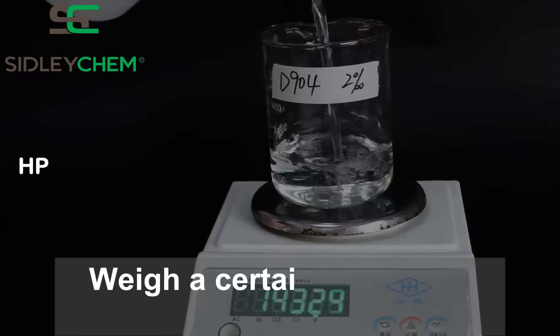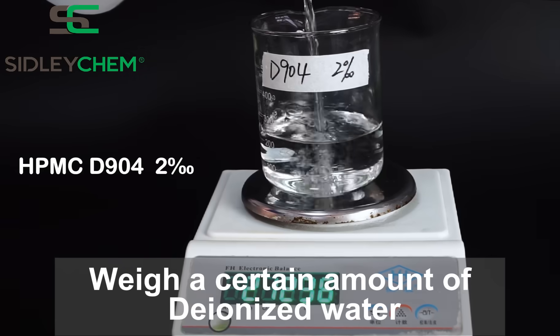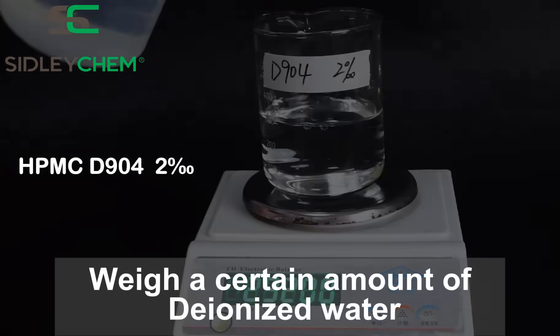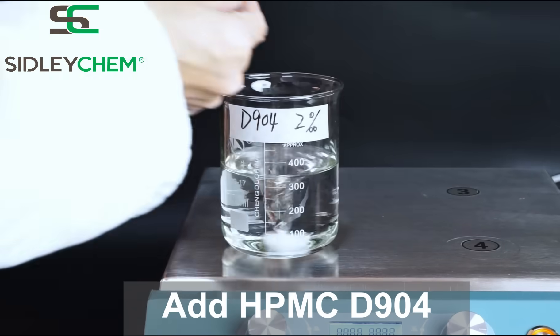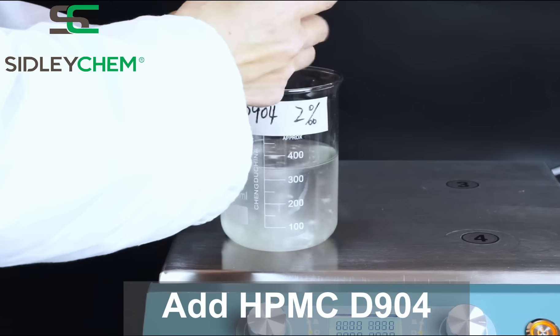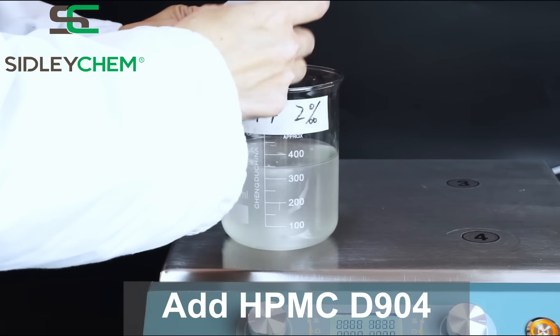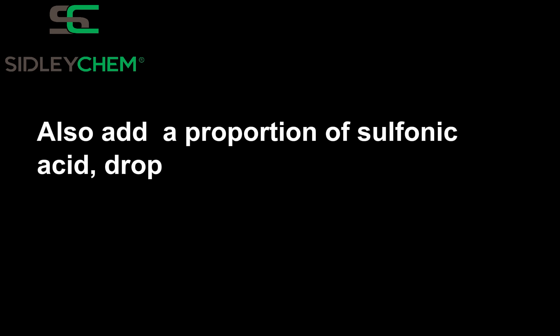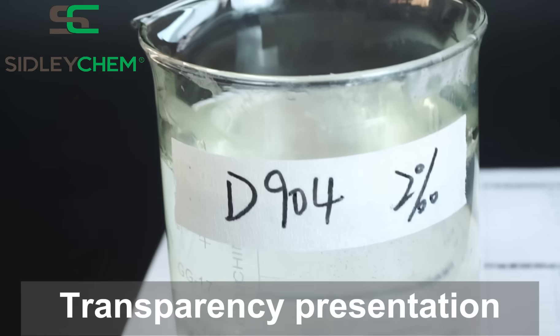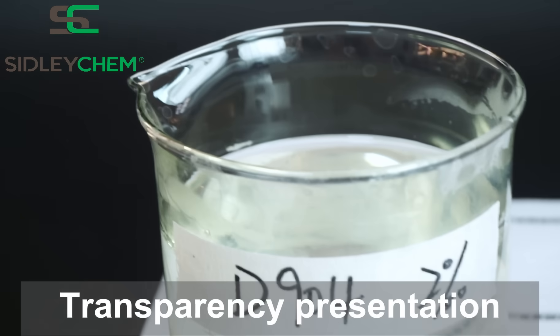Weigh a certain amount of deionized water and add HPMC D904, followed by a transparency presentation.